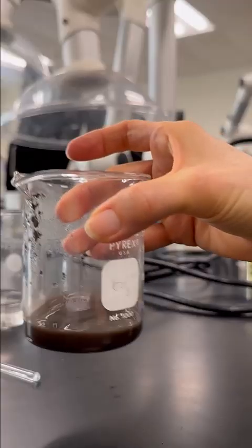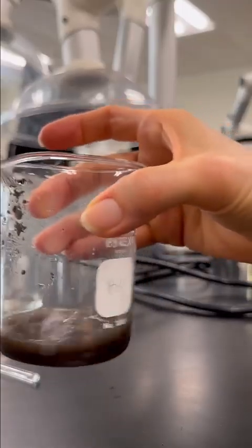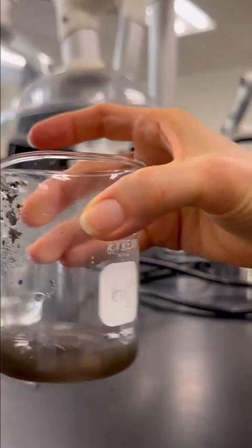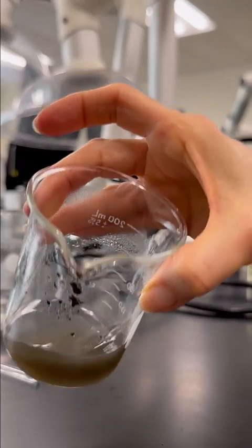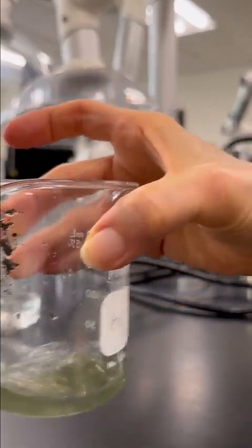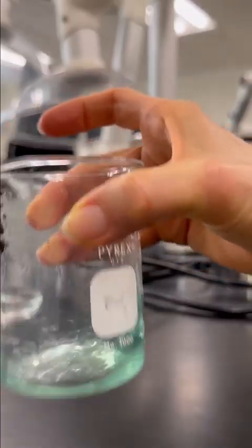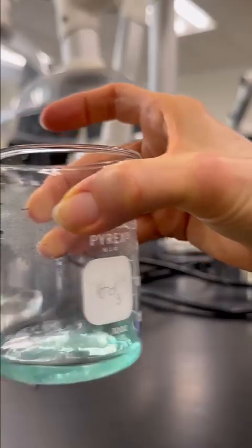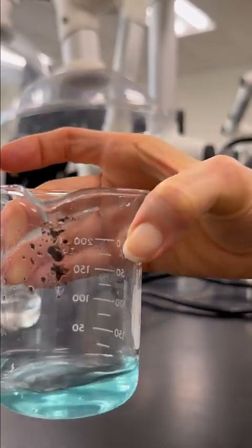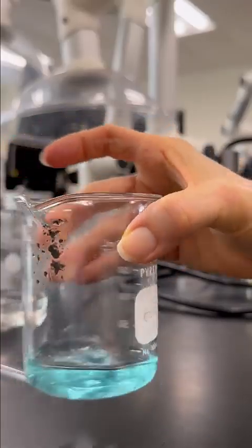This is actually my favorite step in this reaction. All right, so do you see anything going on? Starting to get a little bit lighter brown there. Right, and we are hopefully dissolving here. And this is like magic. All right, so we've dissolved our copper oxide through its reaction with the sulfuric acid. You can see I still have that black stuff up there. We'll get that down here in just a minute.